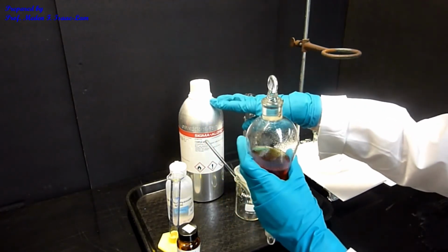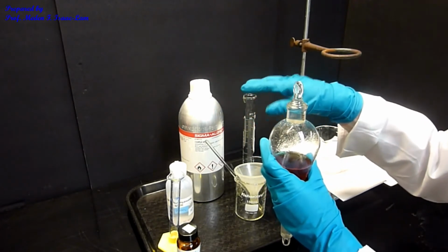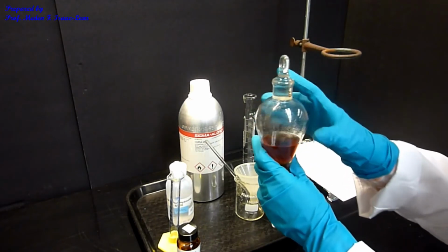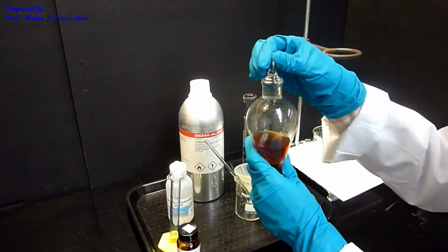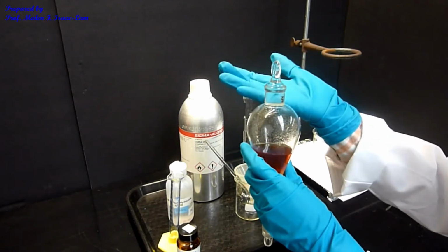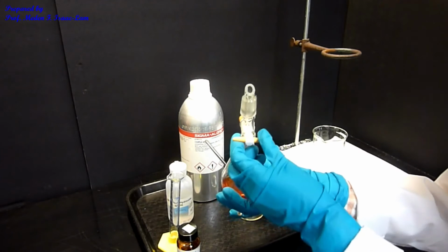Because this is a low boiling point solvent, the diethyl ether has high vapor pressure. When you shake it, the gas or the vapor will accumulate here fast. So if you don't release the pressure, this will tend to pop out, and if you're shaking it, it's going to leak out into your hand. So still wear gloves, okay?